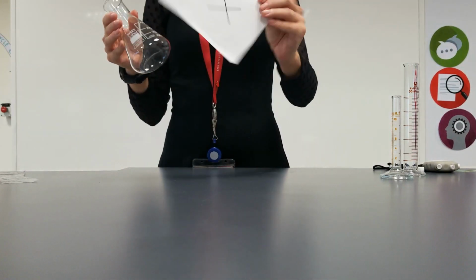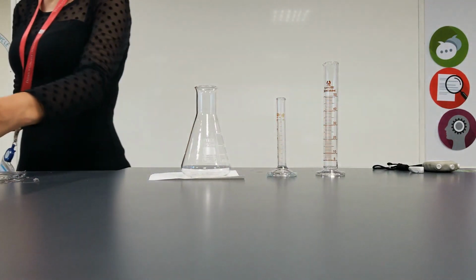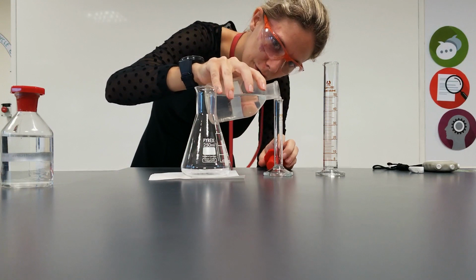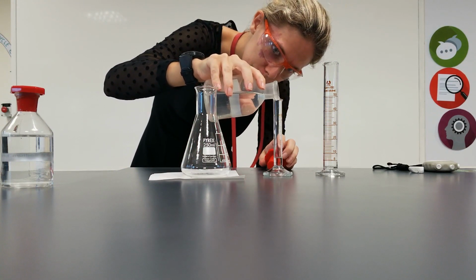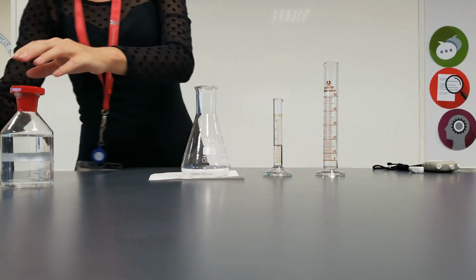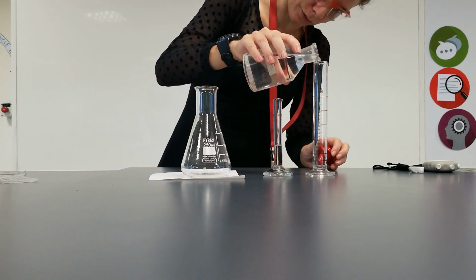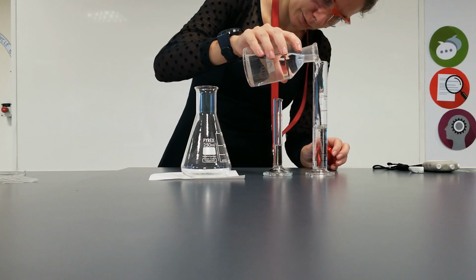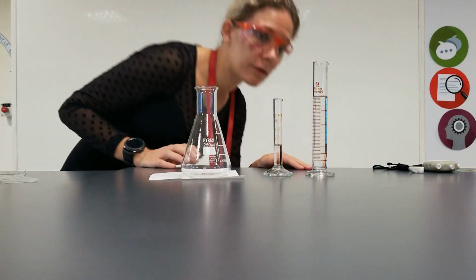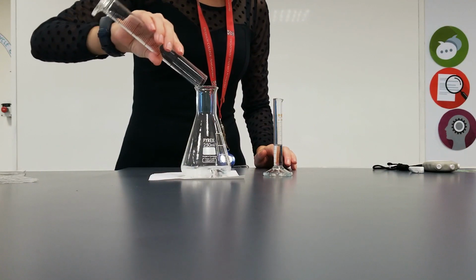So we'd have our conical flask, our cross, our measuring cylinders as usual, and let's measure out our chemicals. So I need 5 centimetres cubed of the hydrochloric acid. There's my 5 centimetres cubed. And I need 50 centimetres cubed of my thiosulfate to do the 0.2. So there we go. And check, yep. So let's put that in over my cross.